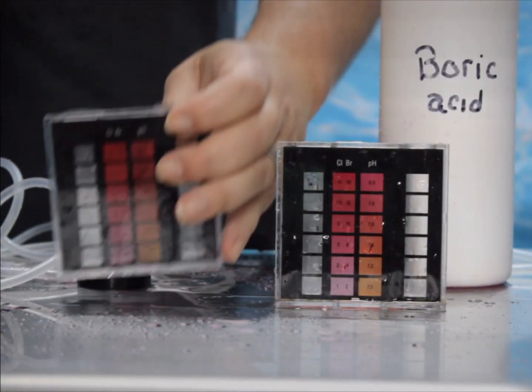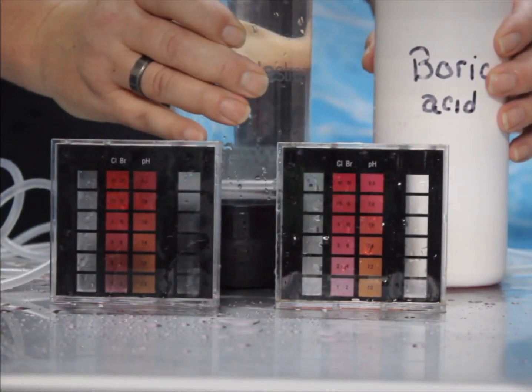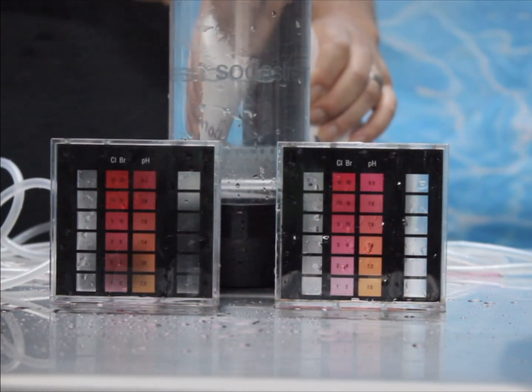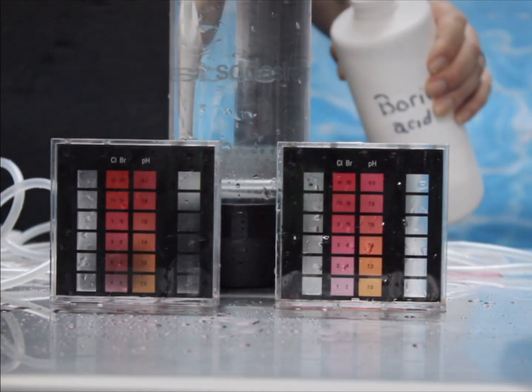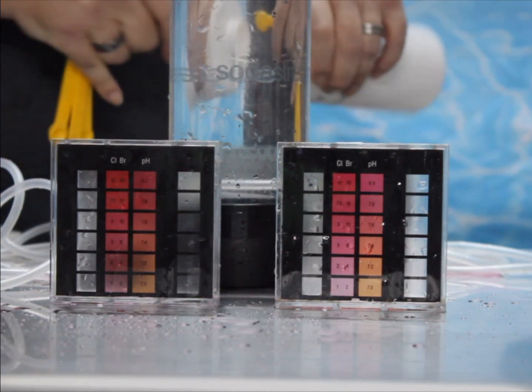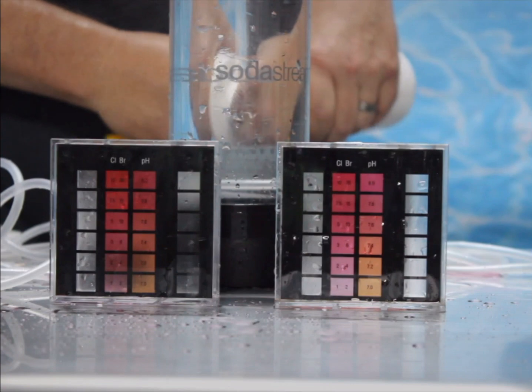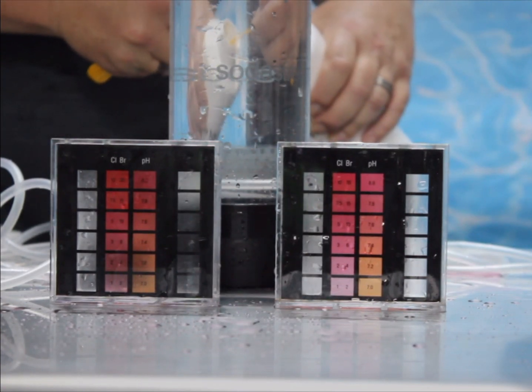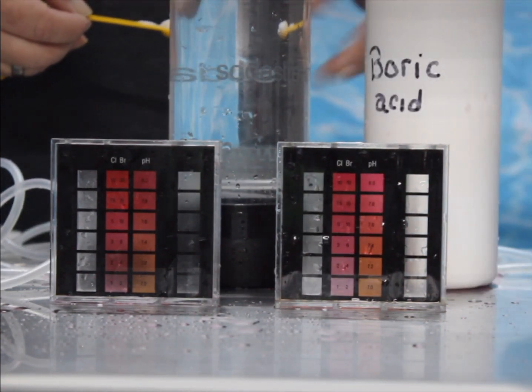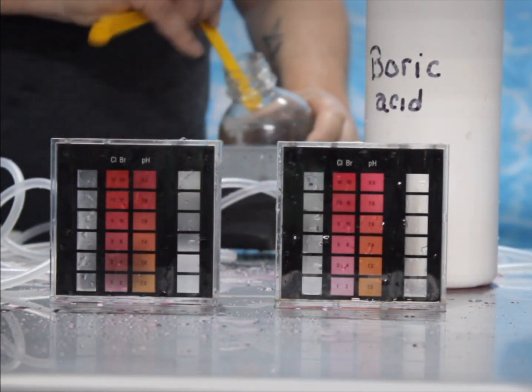Hey guys, it's Rudy Stankiewicz and I have yet another demonstration for you. If you are a fan of borates, you're going to love this one. One sample of pool water — I just filled the larger vial for pH in the test block on the left. Now I'm taking just a little bit of boric acid and I'm going to add that to my sample so I can establish a borate level in this one.